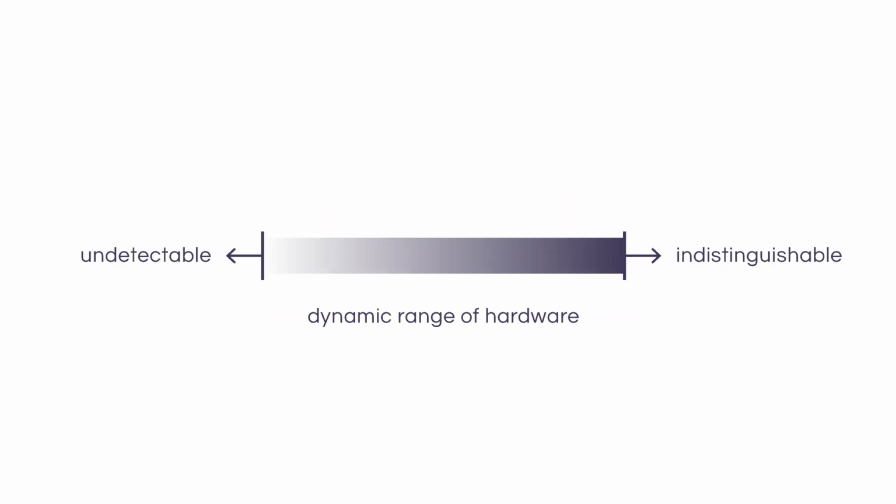If some signals on your blot are lower than the dynamic range of your detector, they will not show on the image. And if other signals are higher than that dynamic range, then they will be saturated. In that case, a band with 10 times the signal of another may appear exactly the same on the resulting image, if they are both saturated. This means that the signals from these bands cannot be accurately quantified, and also the image will give a misleading visual account of your experimental results.